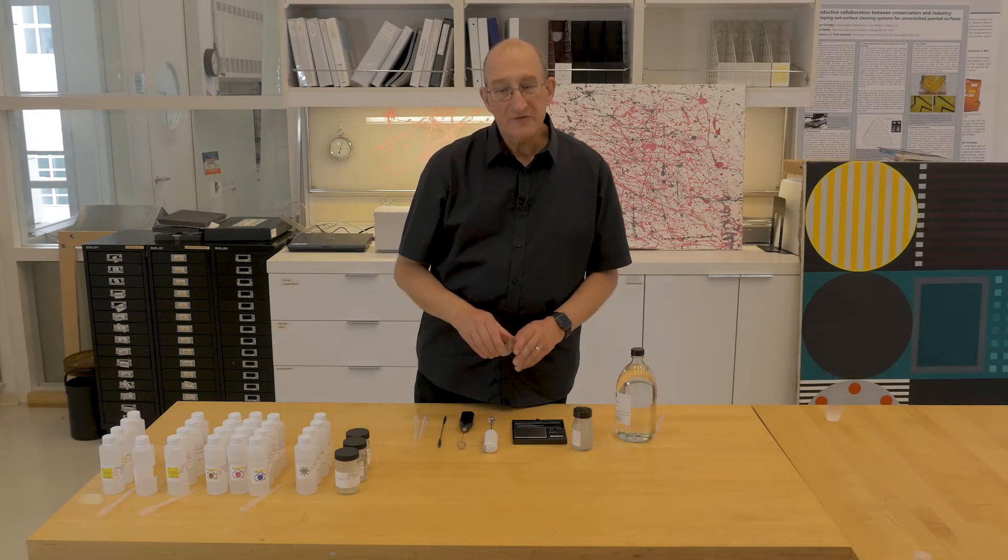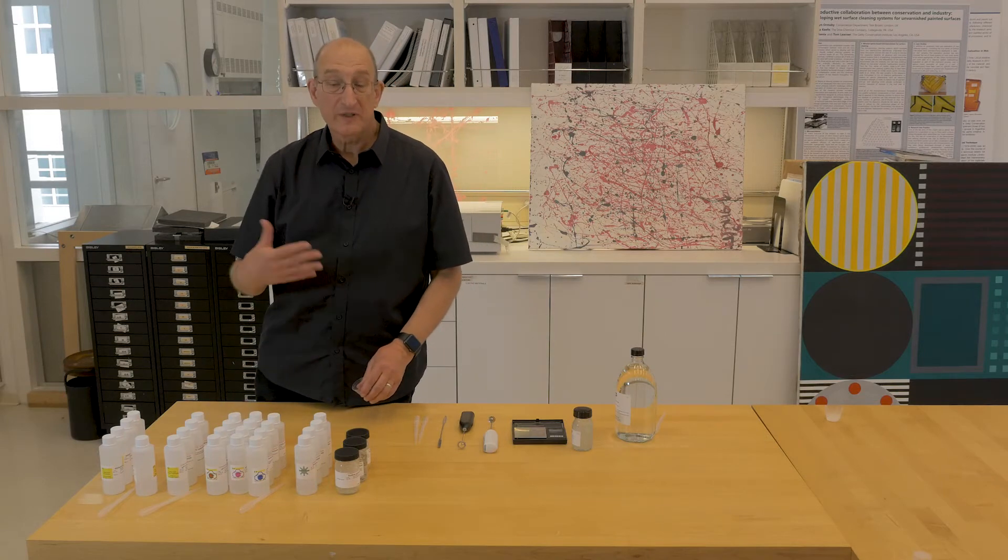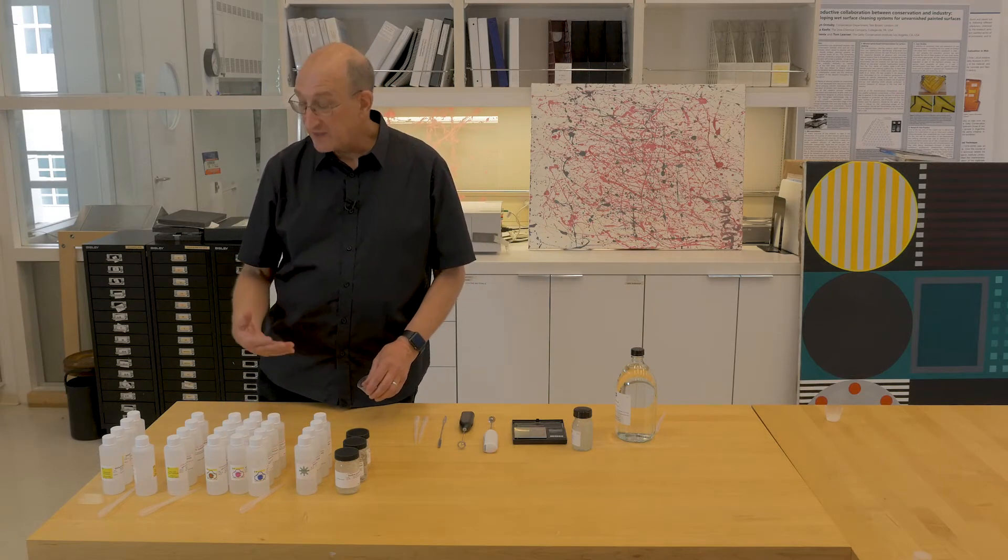We'll make the aqueous phase of the emulsion first. We'll use the Modular Cleaning Program, or MCP, to formulate an appropriate aqueous phase.